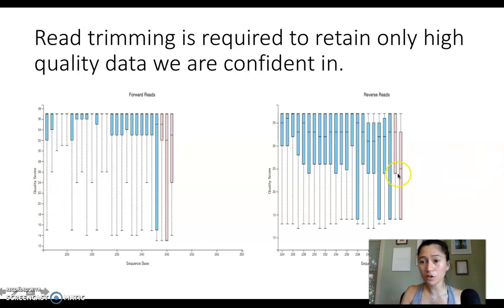And then for the reverse reads, the quality is a little bit lower. I would say this one here is pretty bad quality. The bottom first quartile goes all the way down below 15. So I would say this one here, 237, is really the last good quality nucleotide we want to keep. And then we trim off everything after that.